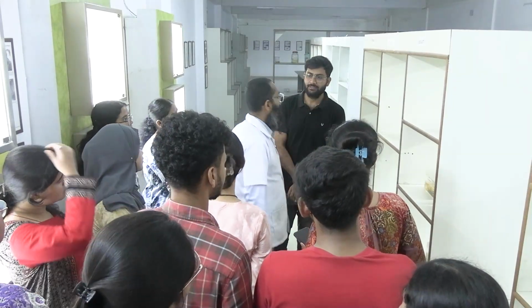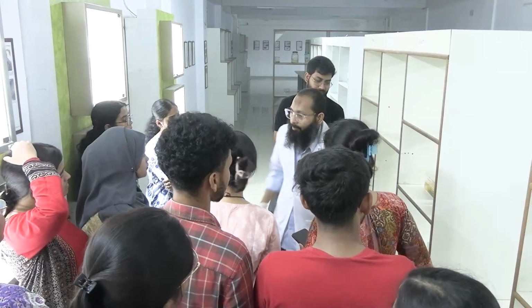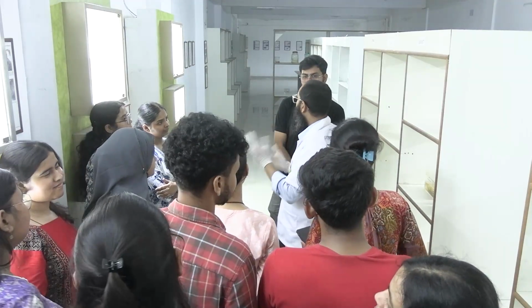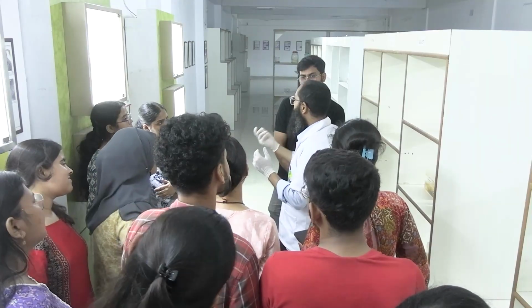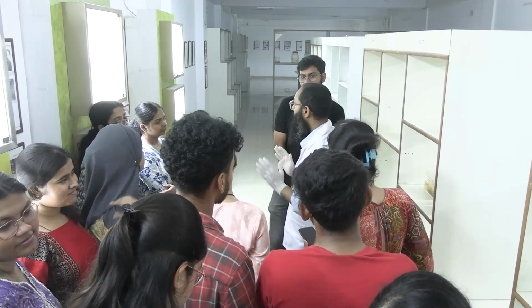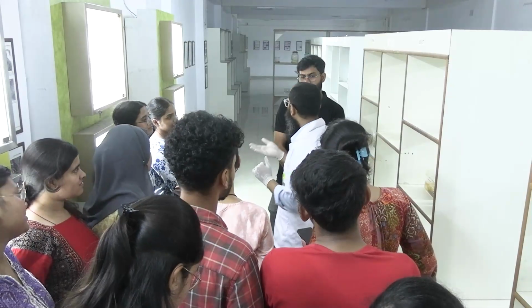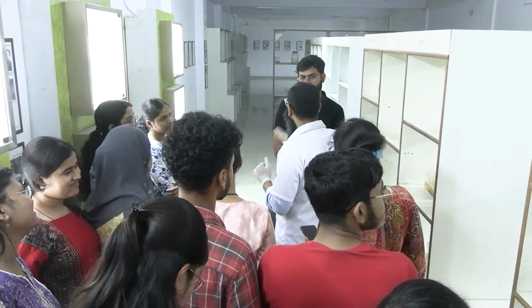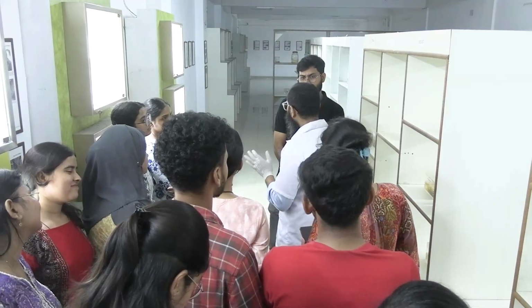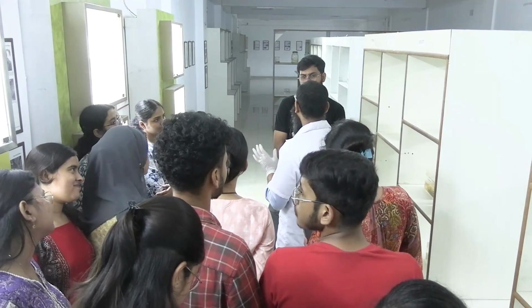Okay, very good. So cold ischemia. The thing is that when the surgery is done, whether it's a biopsy or large specimen, any tissue, once it has been cut out from the patient's body, the oxygen supply and glucose supply are cut off. So there is an ischemic state for that tissue.